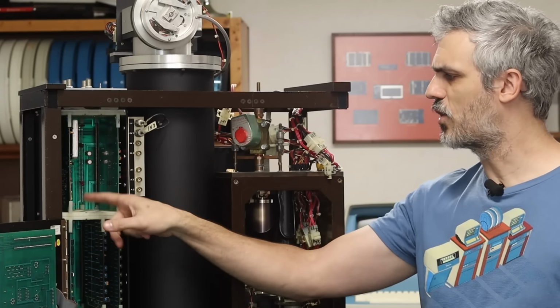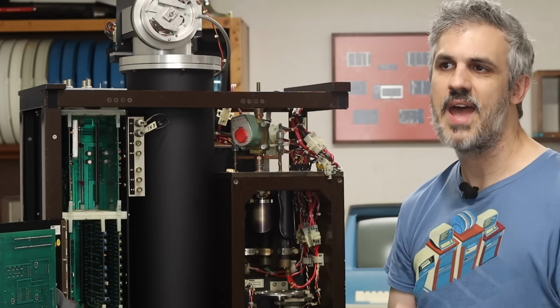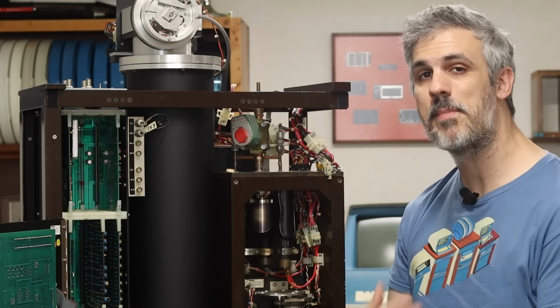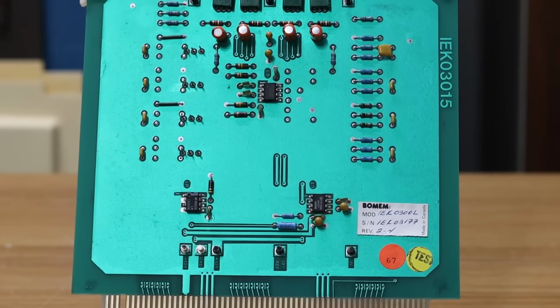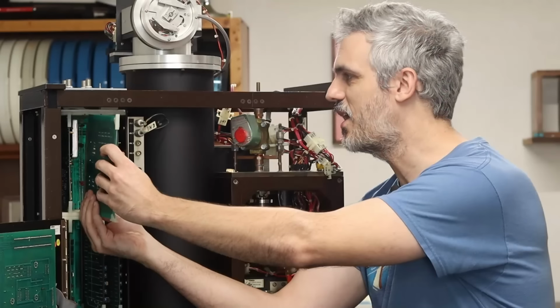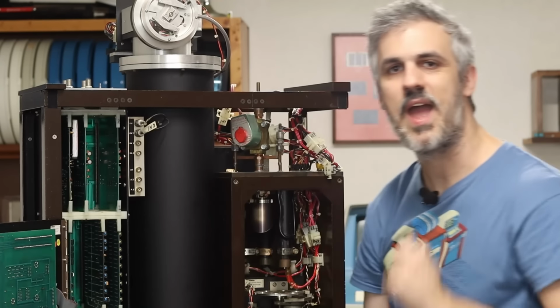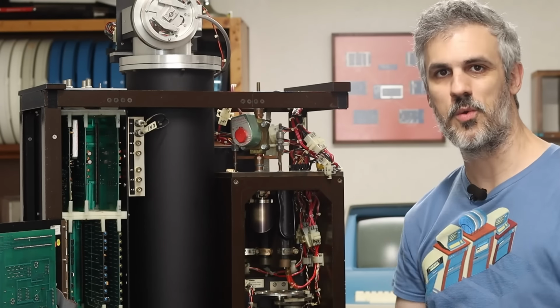So I asked Mike what the card in slot number 2 here would be, and he said, oh, that's the Bridges card. It has to do with the vacuum system. He was swinging by on his way to someplace else, and he dropped off a spare Bridges card. So I got this card right here, I slotted it into slot number 2, we snapped it in, and I went, excellent, I have a full backplane. Nothing more to worry about up here.